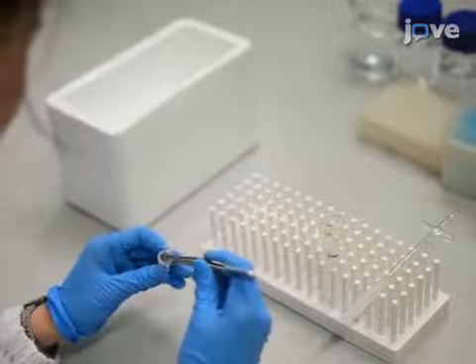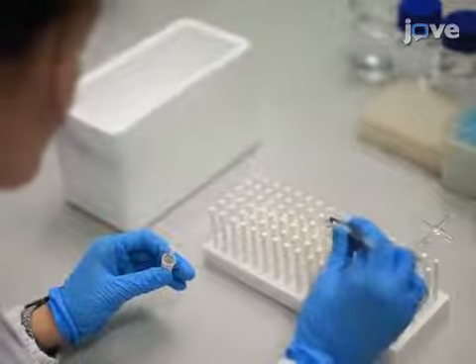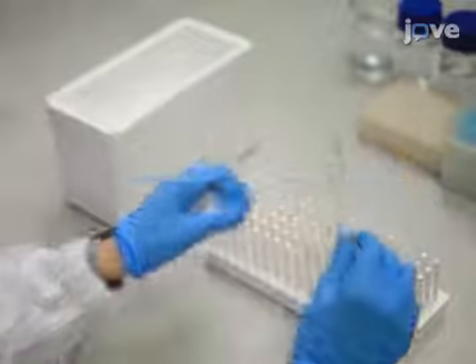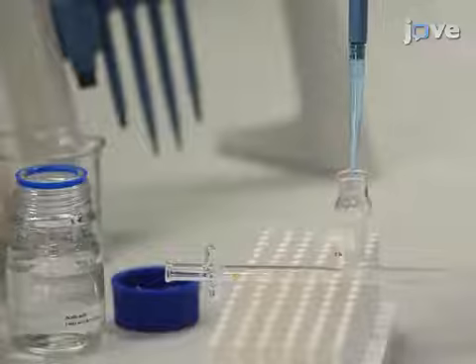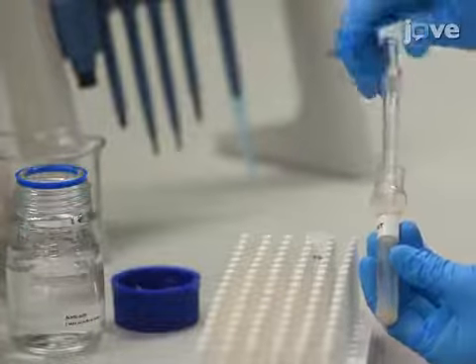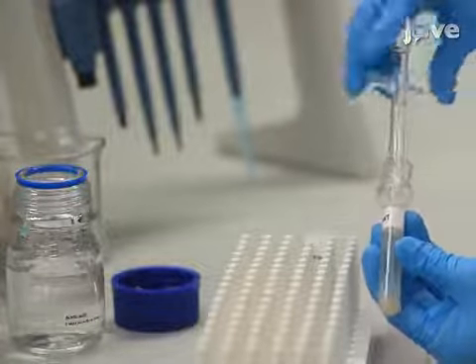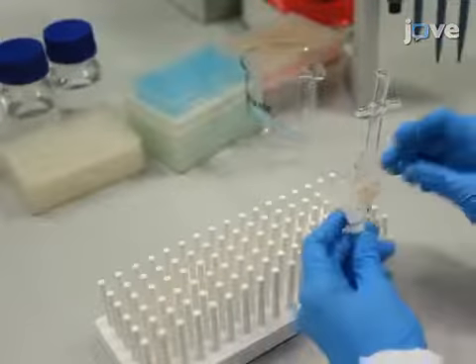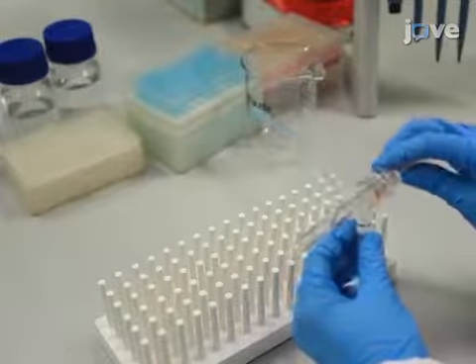Add 1.2 milliliters of the aqueous acetic acid solution and homogenize the tissue by gentle shearing for 10 seconds. Transfer the resulting suspension into a 1.5 milliliter centrifuge tube.